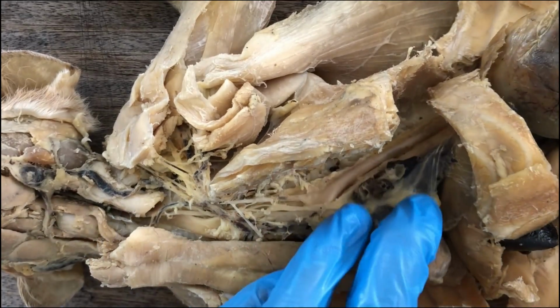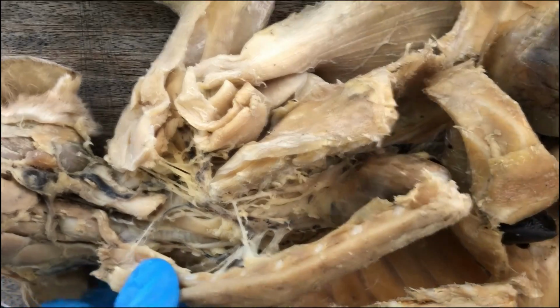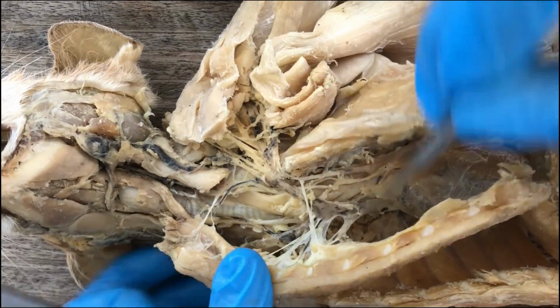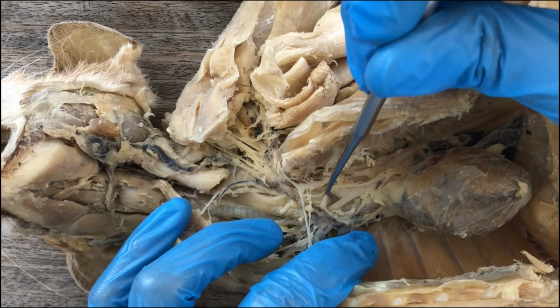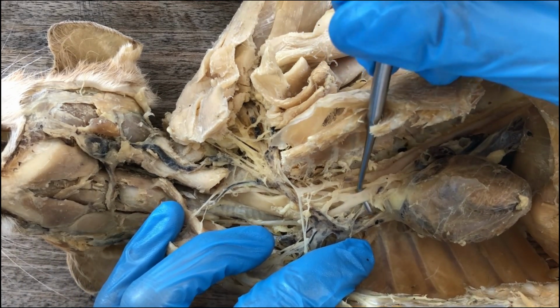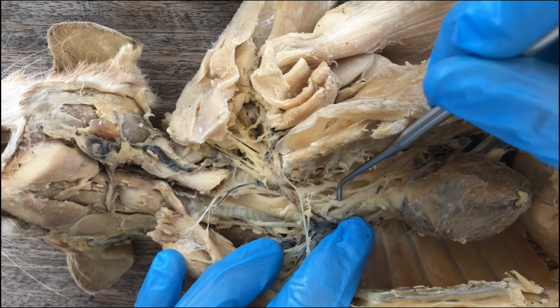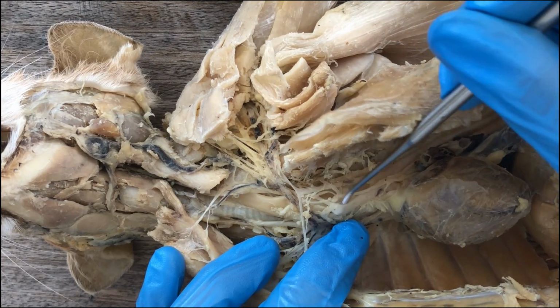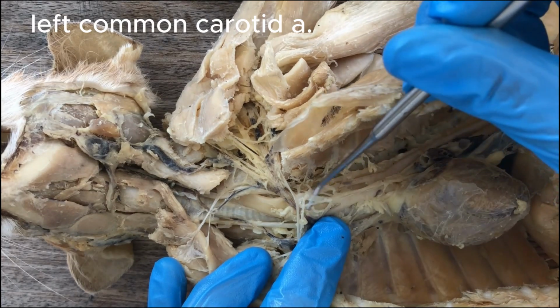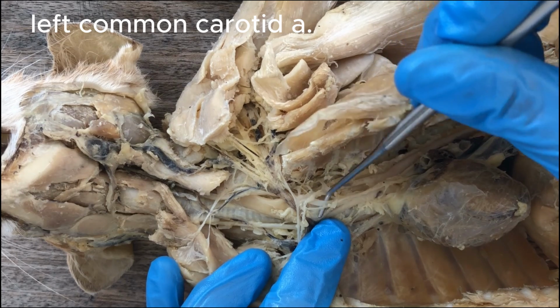Okay, and now we follow the brachiocephalic artery, this one, and then shortly it will divide to give rise to the left common carotid artery.